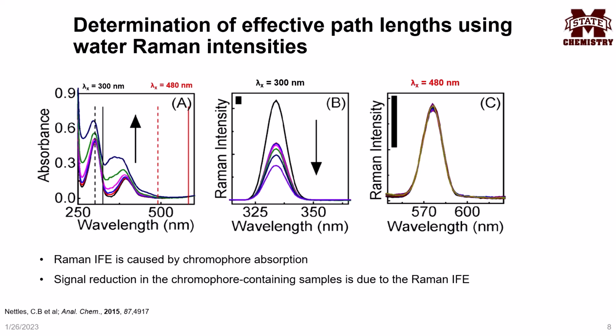At 300 nanometers, the absorbance increases as a function of chromophore concentration, while the water Raman signal intensity at 300 nanometers decreases as a function of chromophore concentration. The water concentration only changes by less than 2%, so it cannot cause a drastic change in the signal intensity. As you can see, at 480 nanometers, the absorbance is concentration independent, since the chromophore does not absorb light at this wavelength. We can see that the water Raman intensity at a wavelength of 575 nanometers is also concentration independent. The drastic difference in water Raman intensity suggests that the inner filter effect is causing a reduction in the Raman intensity.